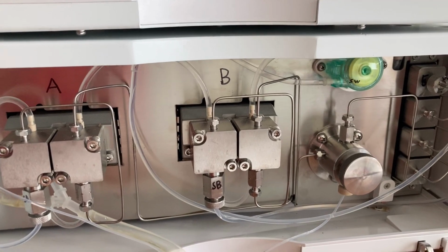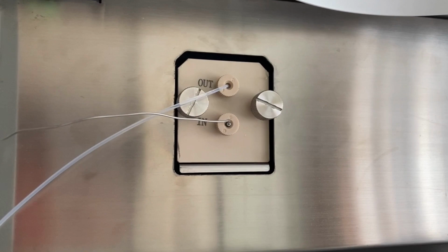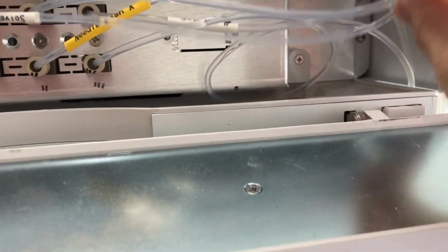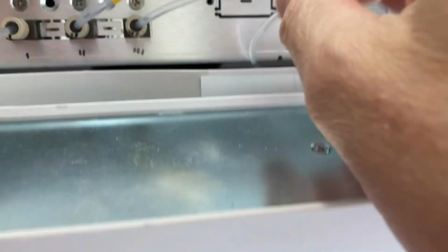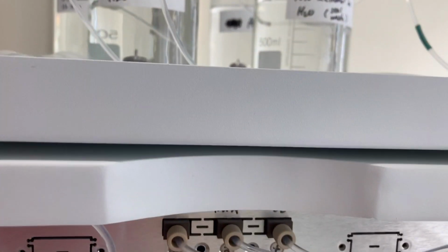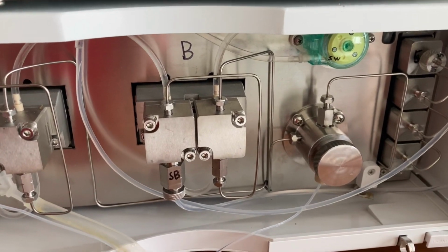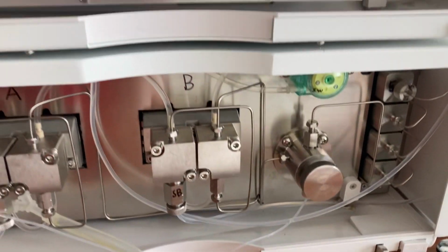So do this about 3 times, and at the same time just look around for any leaks or any problems. Just open things up. Everything looks good. The degasser, you can usually see air or air bubbles or whatever that may need to get rid of. Everything looks pretty good actually. So I ended up purging plunger 4 times and it all looks pretty clear.